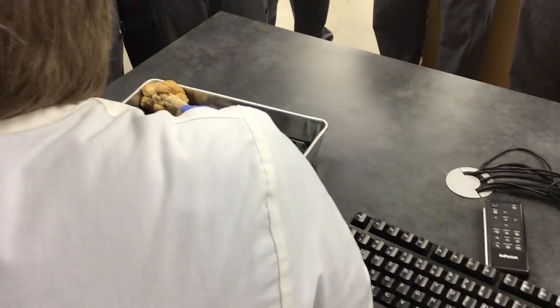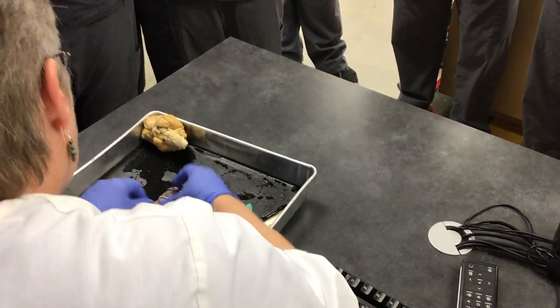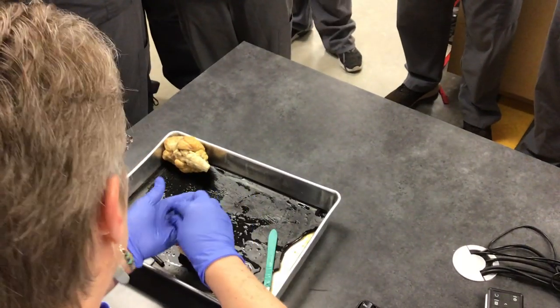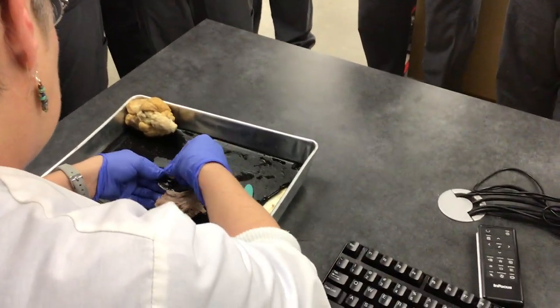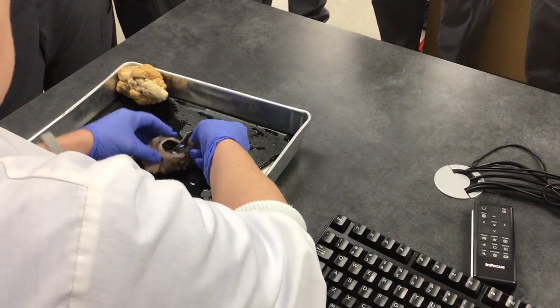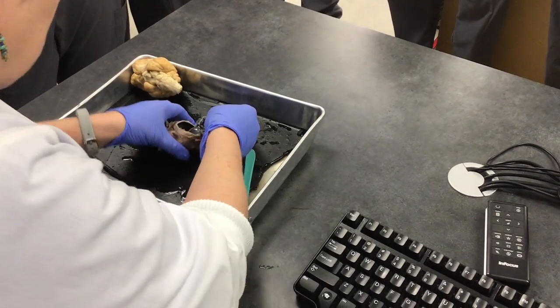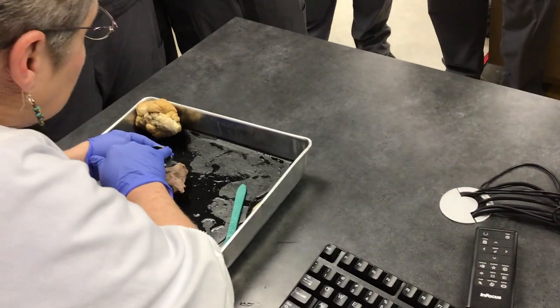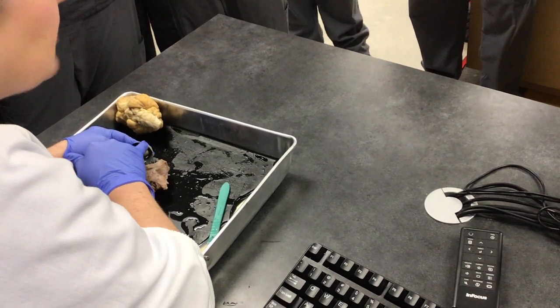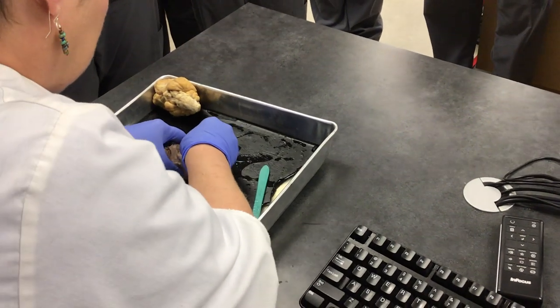So that was the lens. I thought that was the cornea. No, this is the cornea — the big outer part. And this is the lens, which is in the back of the cornea. And of course, all of this white part is the sclera — that's what I cut through.